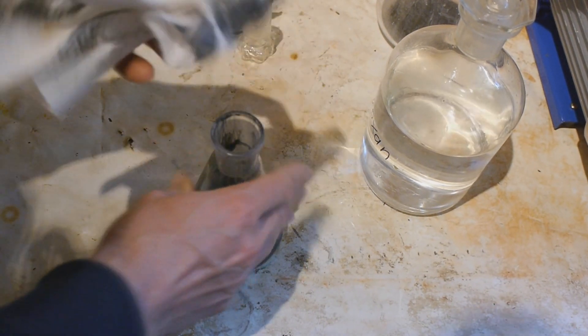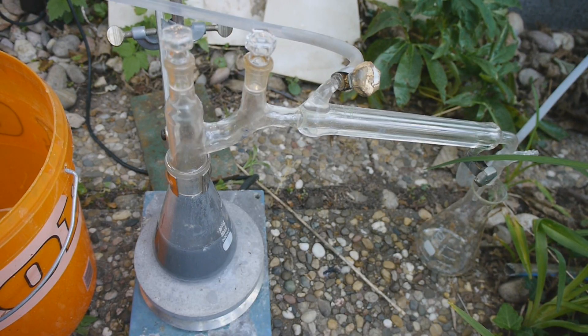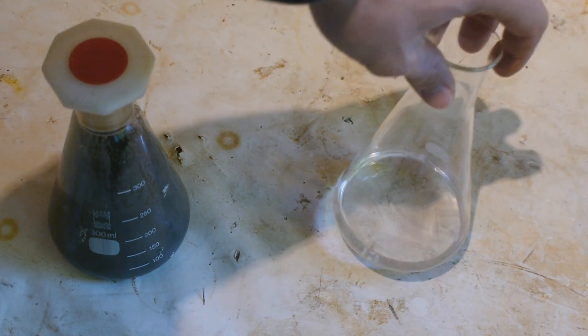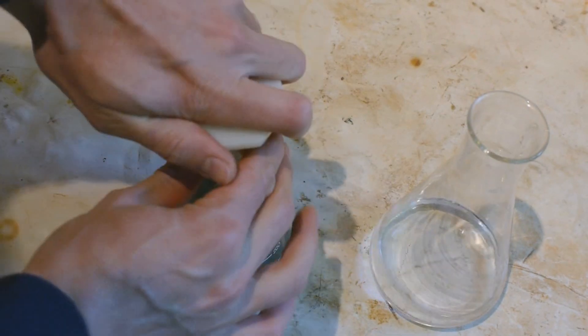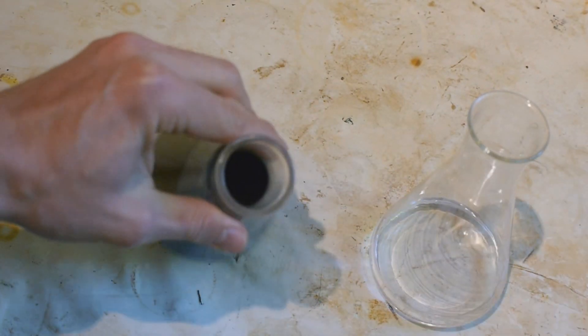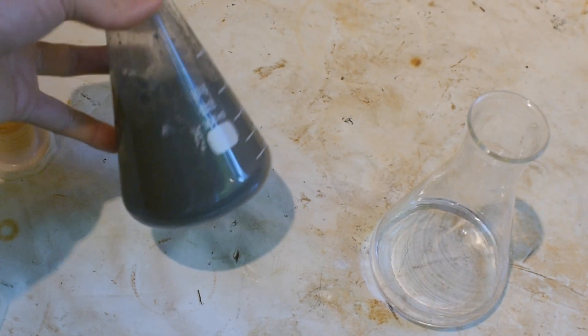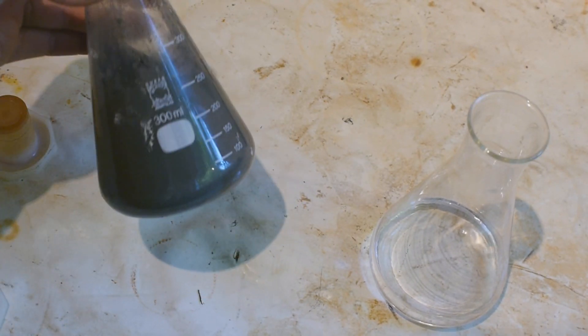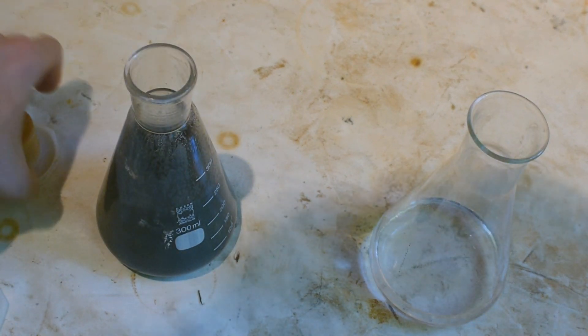Okay I'm just trying to distill off the dioxane right now. And even if we don't get anything, at least we should have some dry dioxane at the end. Okay this is the aftermath from the distillation. So this should be our now hopefully dry dioxane. And well this is just the brown or grey sludge left on the other side. Highly doubt there's any usable quantity of sodium in there. And maybe I would have to reflux it for longer but I don't have the time for it.